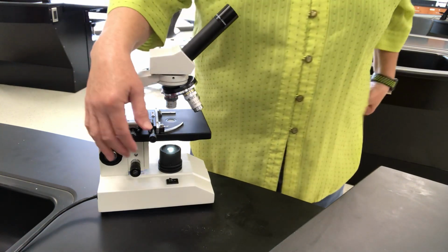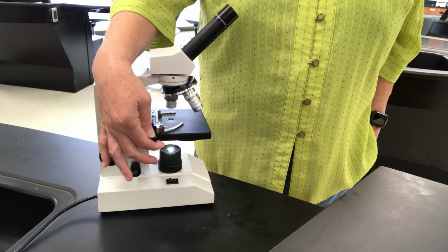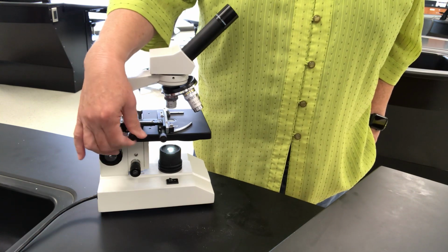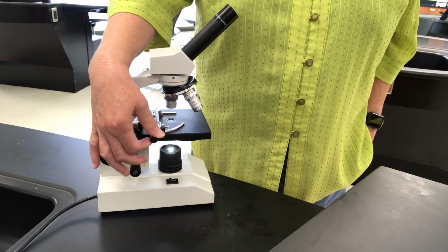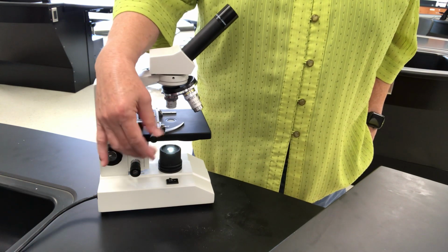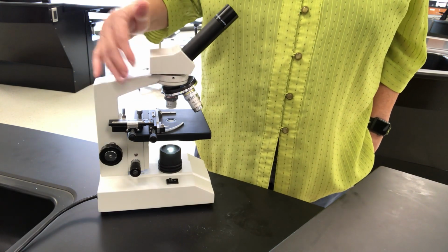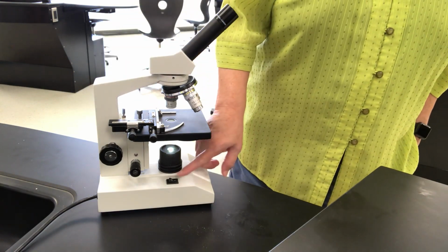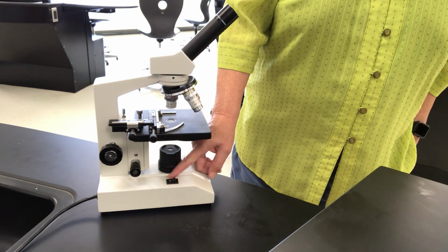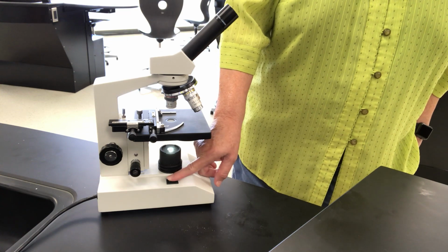And this is the cool part. Instead of moving the slide trying to find something, you have what are called XY axes. You see that it moves this on an XY axis. See how that's moving back and forth? So that's how you actually would look through there and manipulate your slide, okay? Again, your power switch is down here. If it's flat with the O, that means off. If it's in line with the line, it is on.